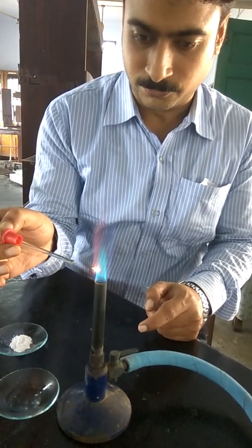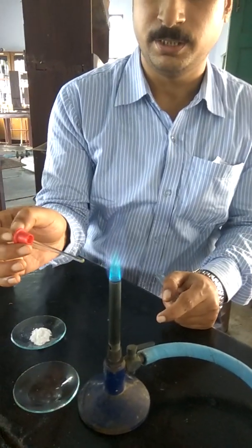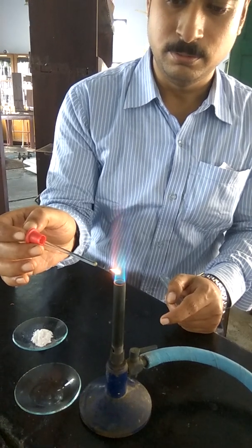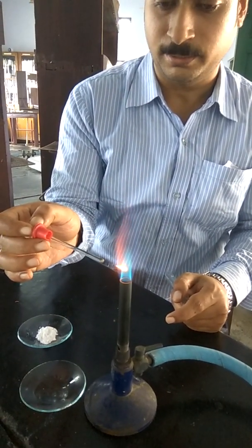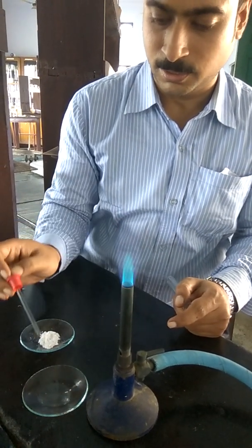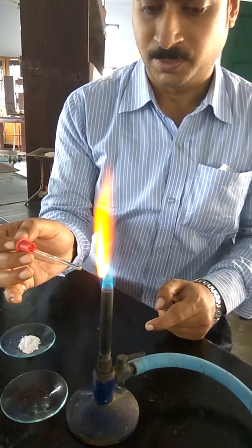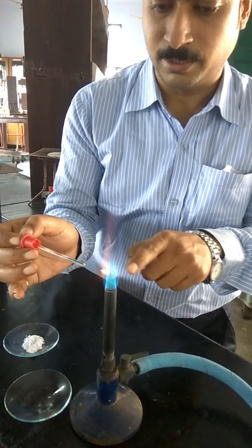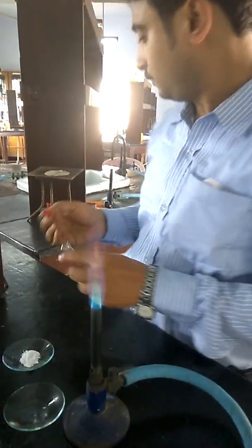The chlorides of metals are generally volatile in nature. On heating, it will directly form a cation. On further heating, electrons will go to the higher allowed path, the Bohr's orbit. When they jump back to their original positions, a characteristic color is observed in the visible region. In this way, you can observe. Look at this, the non-persistent brick red coloration for the calcium.